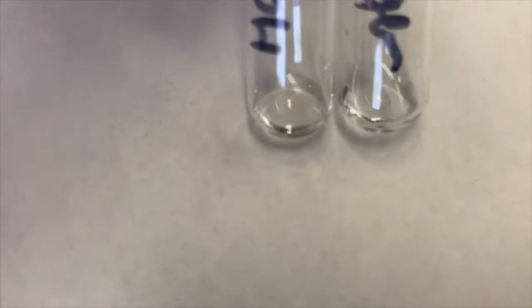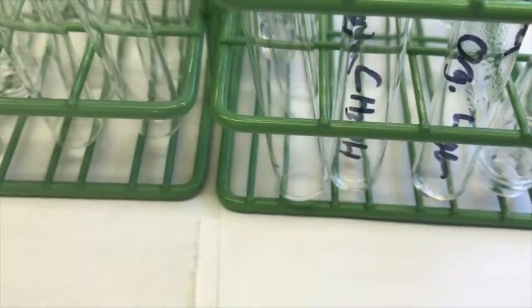Yeah, they're both looking good. I think they both dissolve completely perhaps, huh? And so we started with them not being soluble at room temperature, at cooler temperatures, but then soluble when we heated it. So that's a good crystallization solvent. So when I cool these, let them cool here, they should crystallize back out over time.